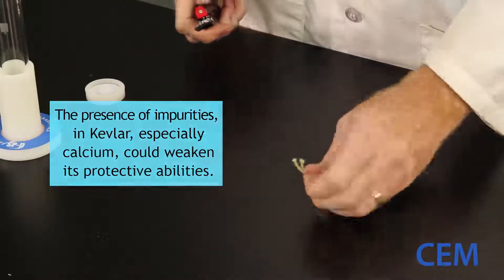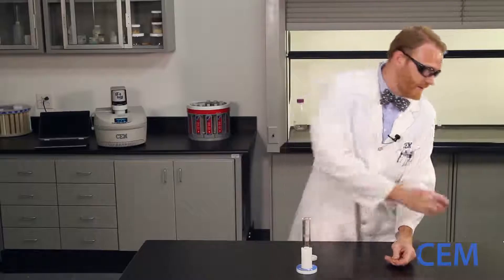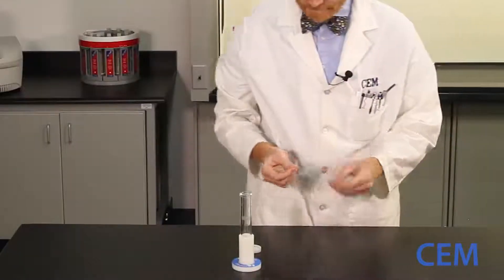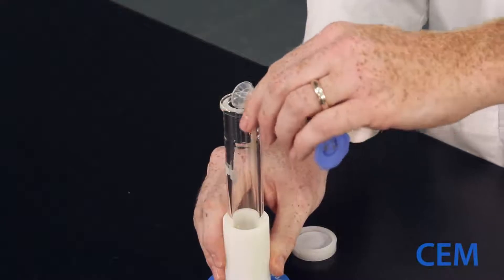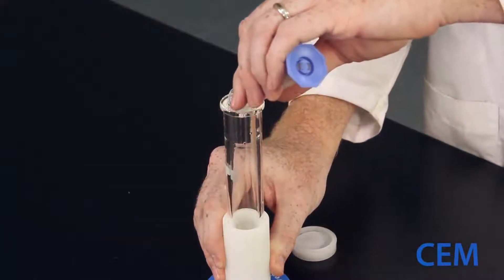There we go. And we're going to digest this. Put a small sample. Pour our acid in, making sure that everything is properly wetted.